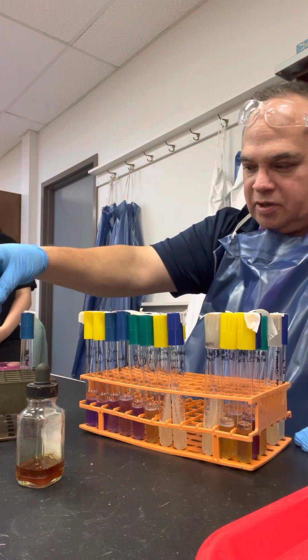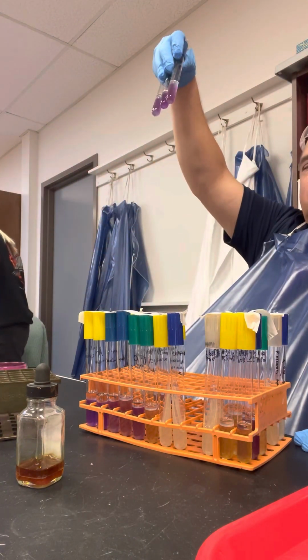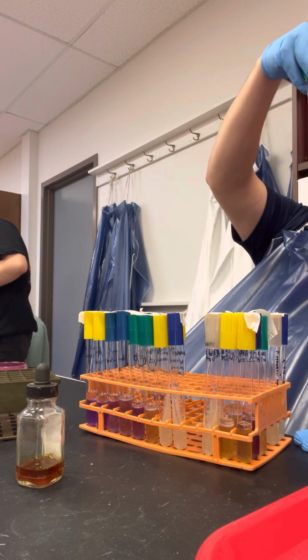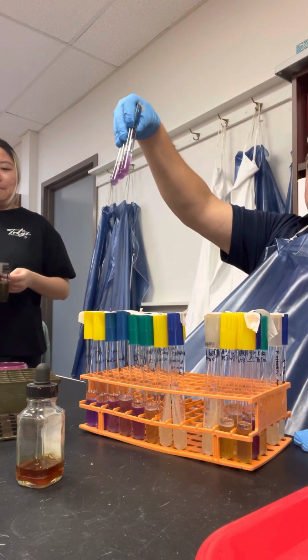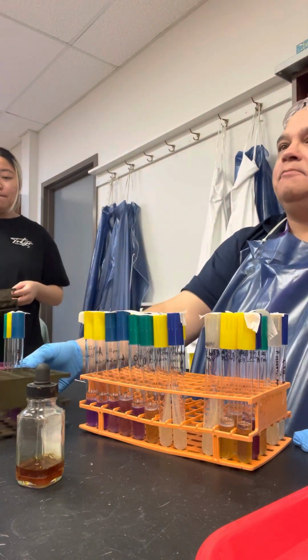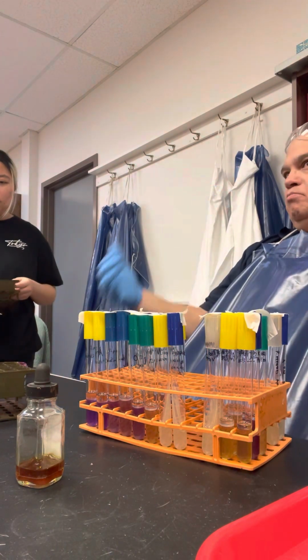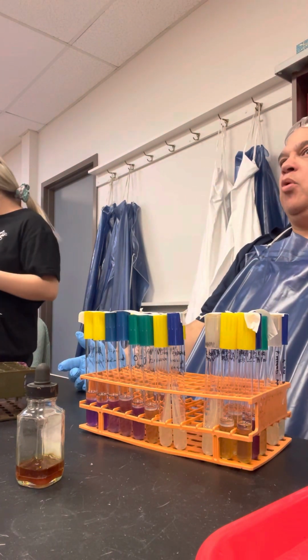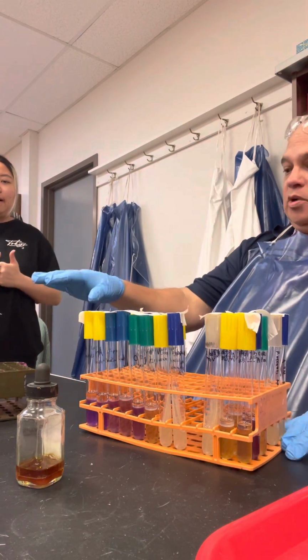And so if we look at this other set, are these valid? No. One is. Why? Because they have oil on top. They're anaerobic. And which one's positive? All of them are positive. And we're looking for basic? Basic. And that's really represented by a purple or violet color. So that's really good.